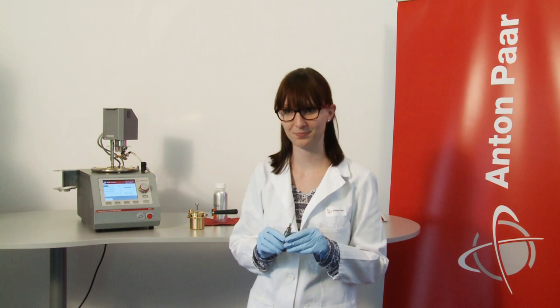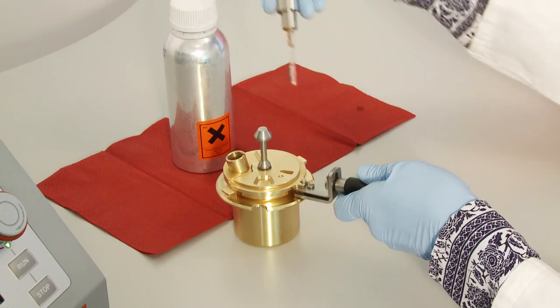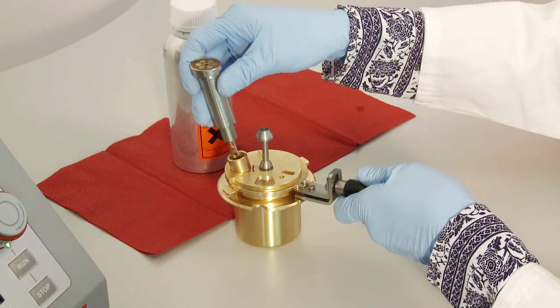And insert the multidetector into the opening. Why is it called a multidetector? Good question, Tony. It's called a multidetector because it includes both a PT100 temperature probe and a flashpoint detector. This gives you a unique advantage. Because of this multidetector, the cup lid only requires one opening and not two.